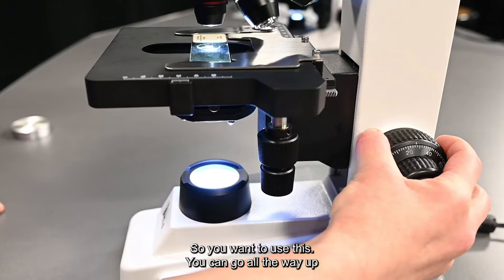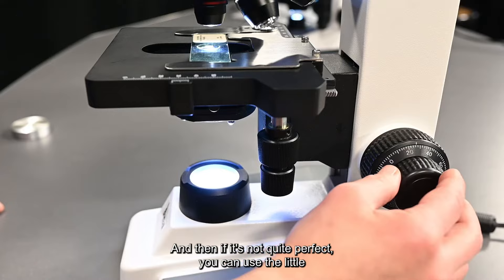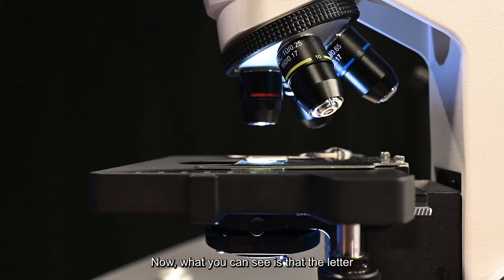You want to use this. You can go all the way up and all the way down with it until you see it. Then if it's not quite perfect you can use the little inner knob to fix your focus.